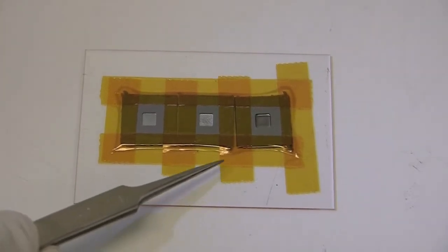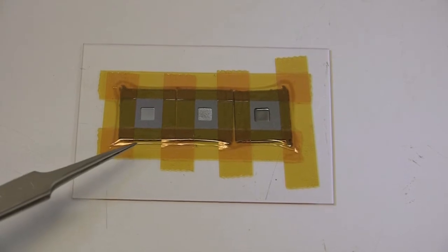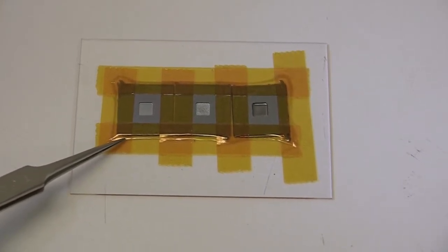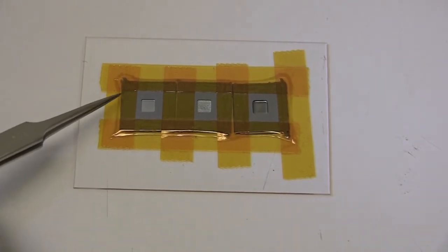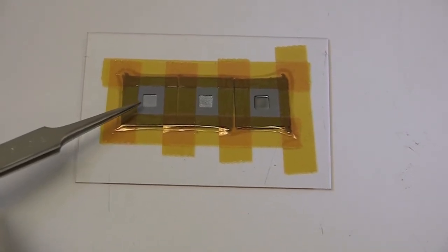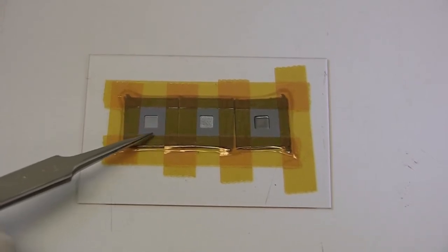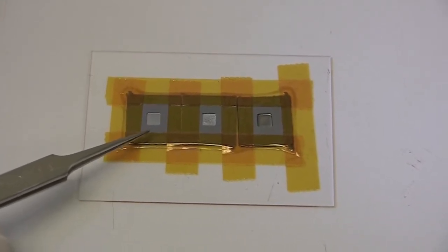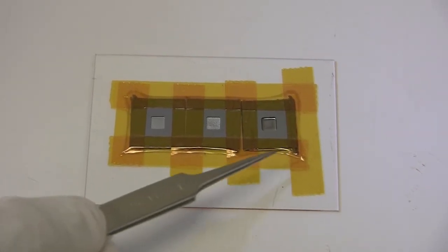As you notice here, I taped around the entire edge of all three chips. This is because on the edge right here, there is silicon, and I want to make sure that's not exposed. You'll notice that I did not tape to the edge. I'm trying to etch this little square here. The edge actually is silicon dioxide that's been thermally grown, so it's a good mask for this machine. So we don't have to tape so precise, just enough to cover the edges.